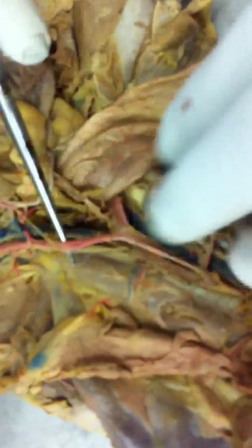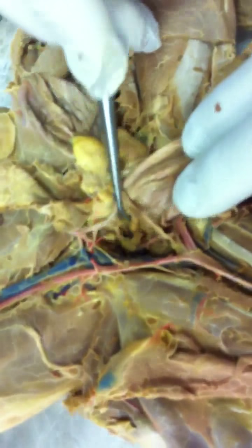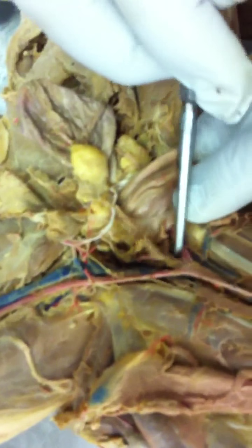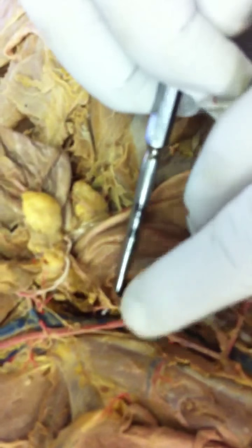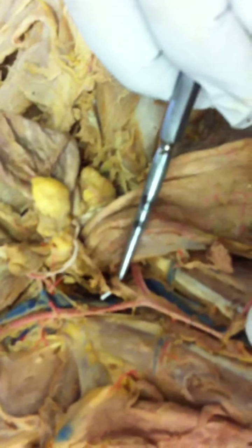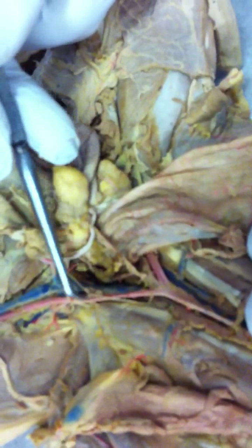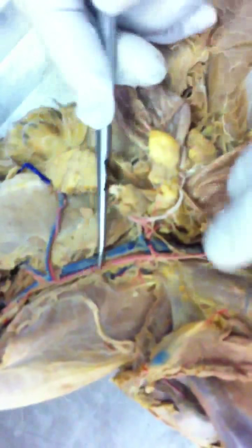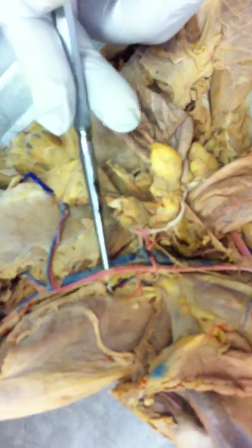Then the aorta continues on down and branches toward the pelvis into the external iliac artery on the left and the right, and then medial to the two external iliac arteries are the two internal iliac arteries coming off a central stem, like a little Y. This external iliac artery goes out into the leg as the femoral artery. There it is, running right along where the femur is.